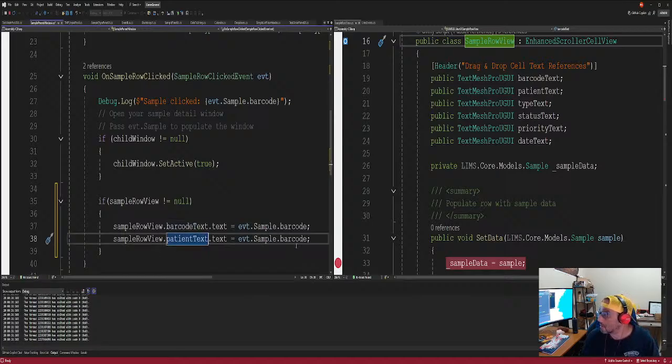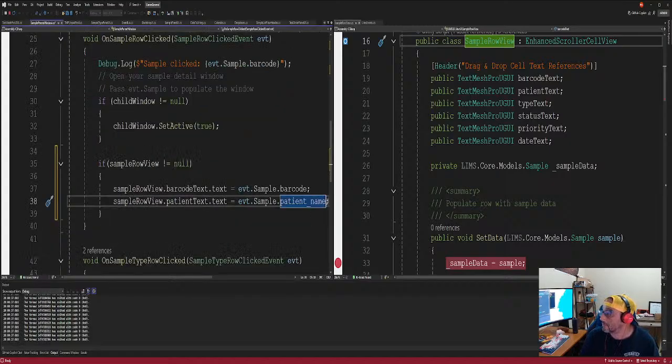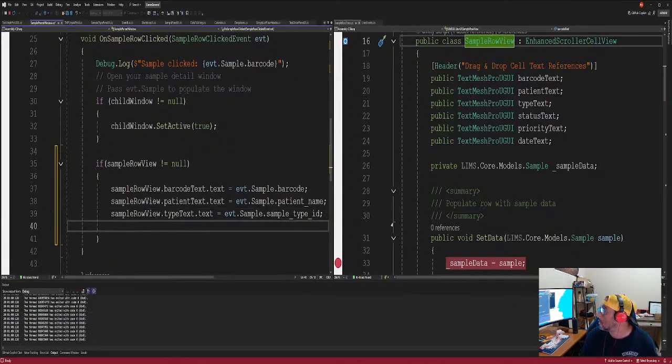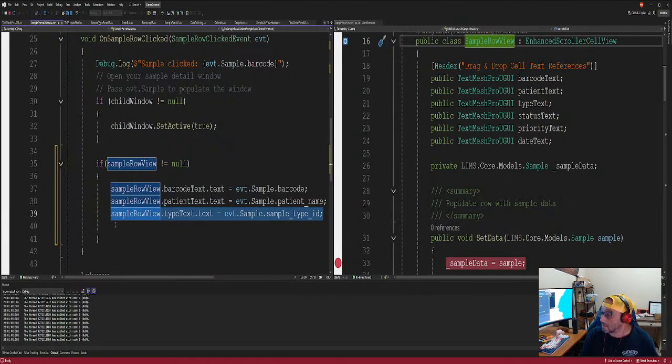Patient text. Let's say patient name. This is what happens when you plan ahead too far. All right, so then we have not patient text, but type text. Right, and then we want to type. It says ID, but through it. Again, we gotta refix. We gotta rename all those. All right, man.